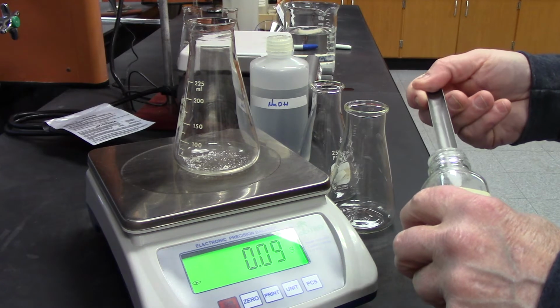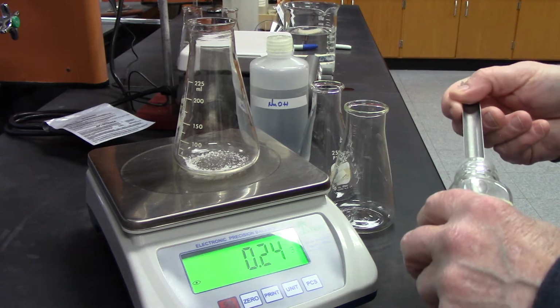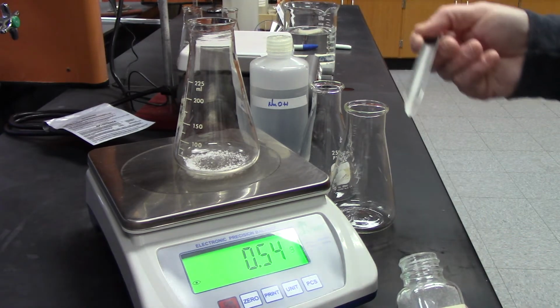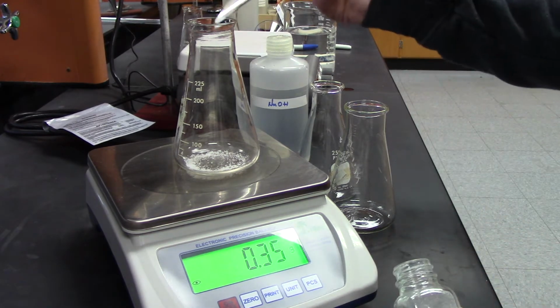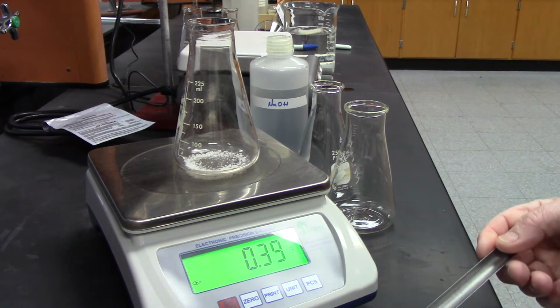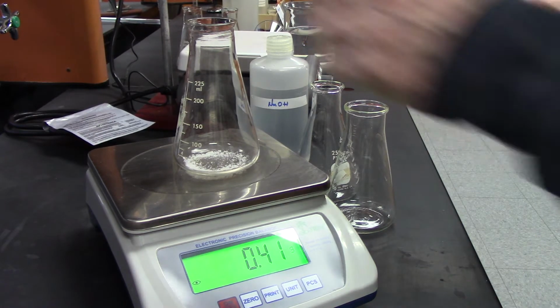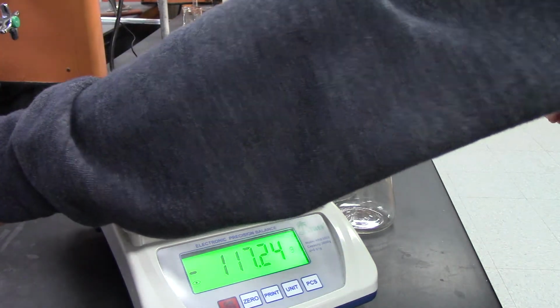A little more. Okay, so the first one is going to be 0.41. I'll write that down. 0.41. Remember that.